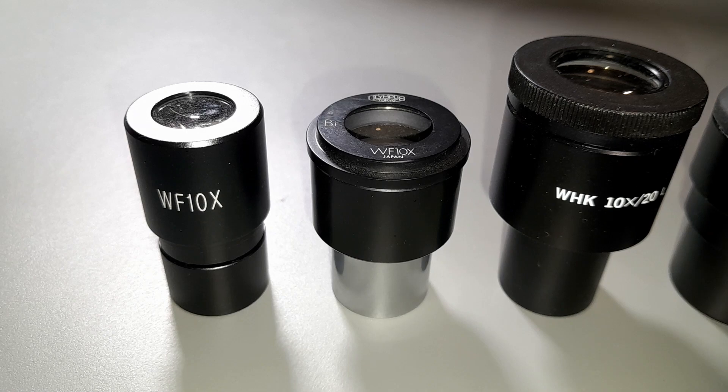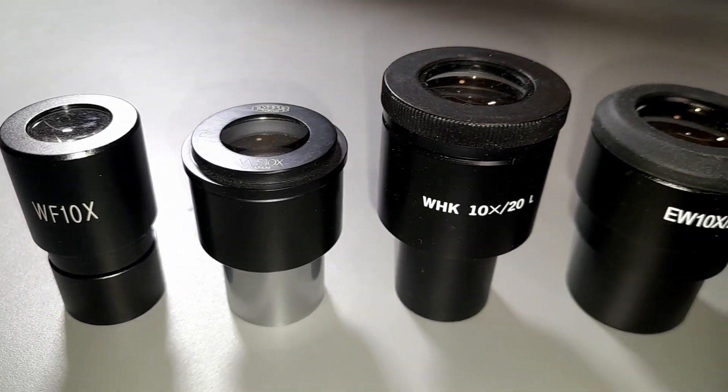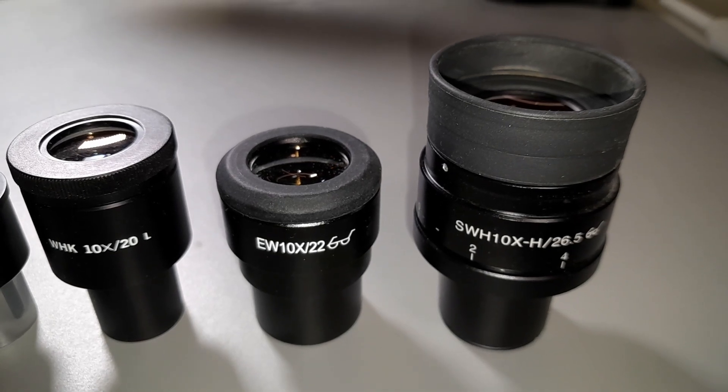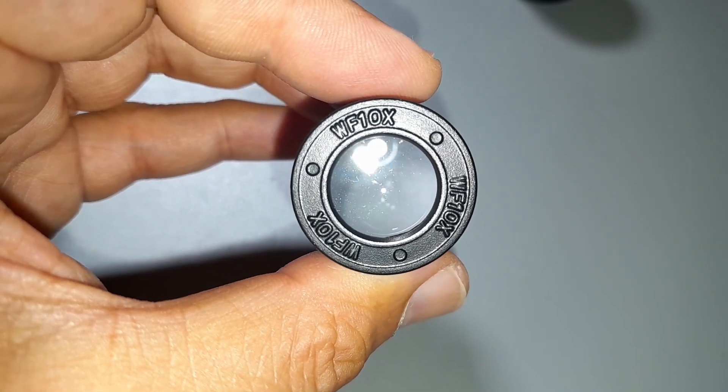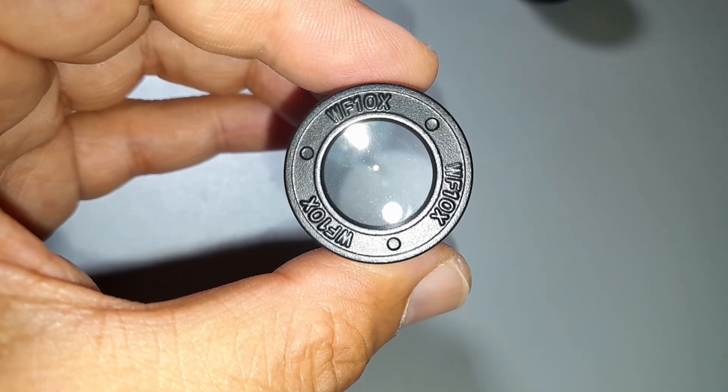What I'm going to do now is give you a short demonstration of how different eyepieces actually look through the microscope. I selected a few of them here. I actually used my mobile phone and took a picture directly through the eyepiece, so it is a very direct view of what you're going to see. These are the eyepieces I'm going to put under the microscope — all of them have a magnification of 10 times, but as you can see the size is already quite different. This one over here is the smallest and cheapest one — it says WF 10X, but it's not a wide field eyepiece. I think it's a little bit of a misnomer — it's made fully of plastic, very cheap.